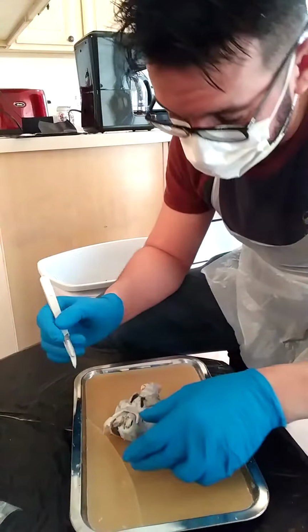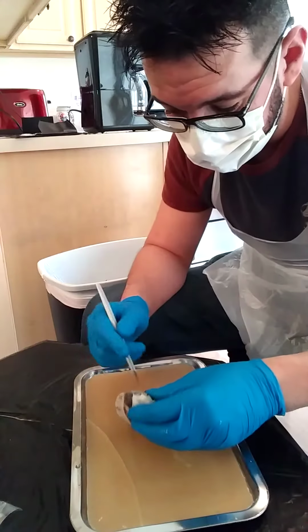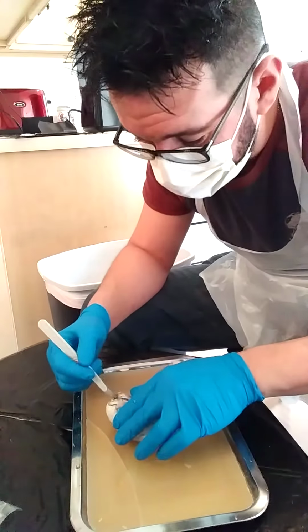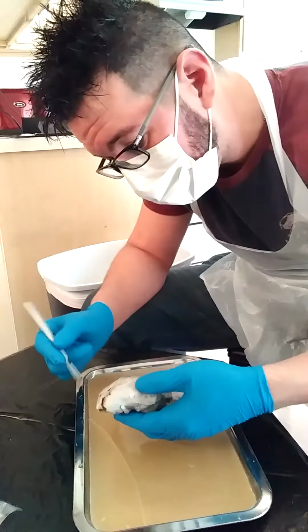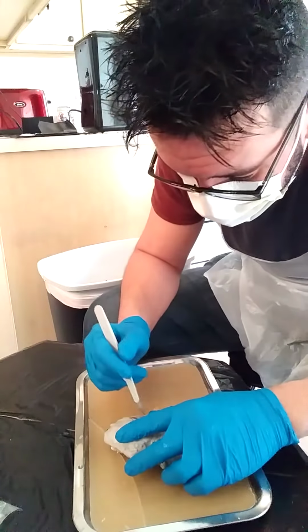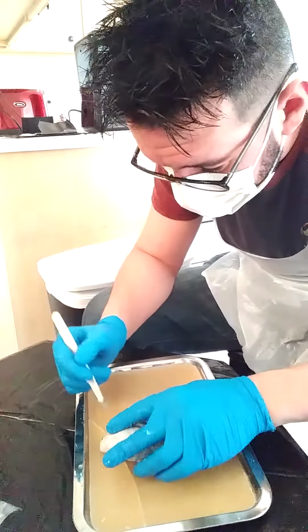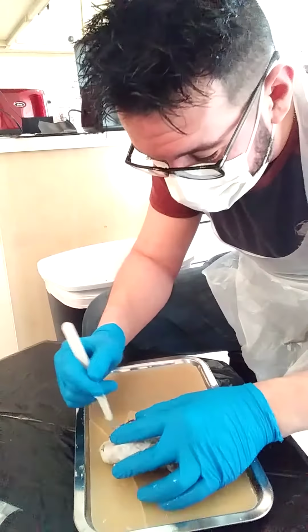Try not to split too much here. And here's hoping that I have not completely torn it up.